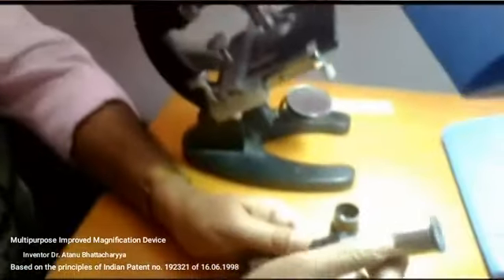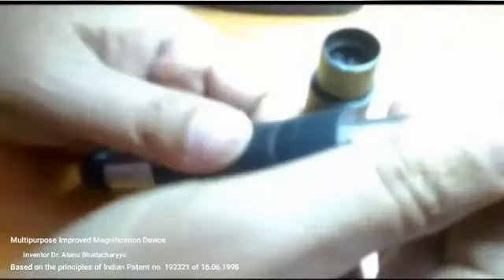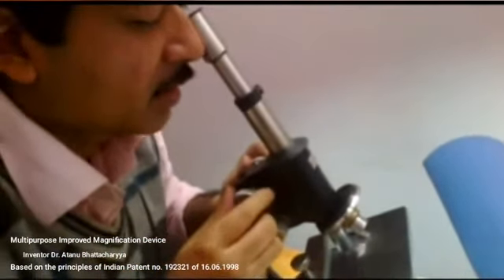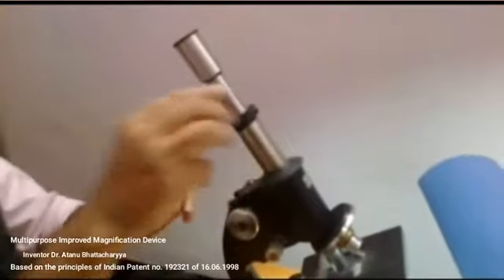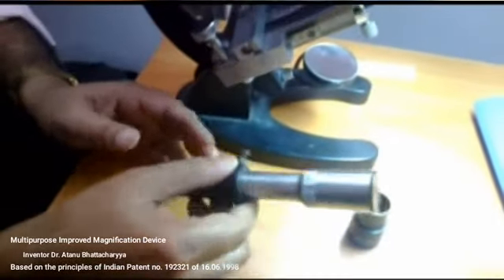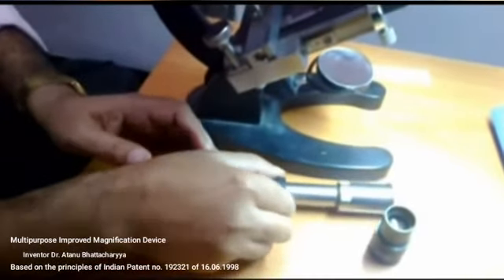By the same method, here it is written 10x and I am pulling it. Here it is written 15. So keep it on the microscope using the 10x objective, and I will find 150 times magnification. This is the method of making the graduation on the T1 tube. Now this is the description all about the device.